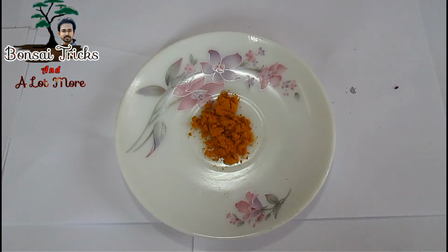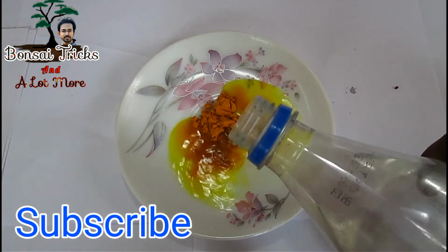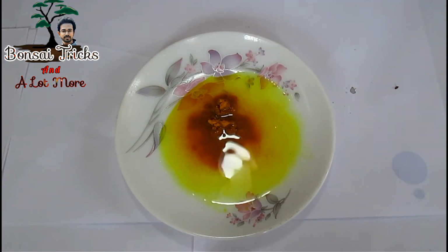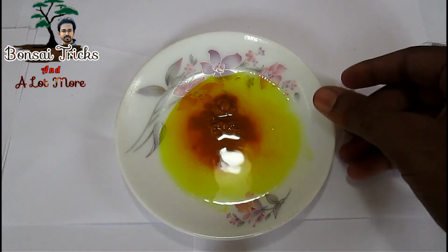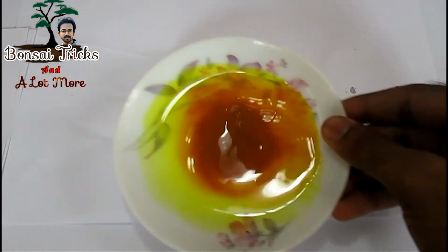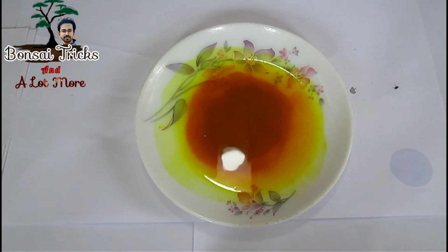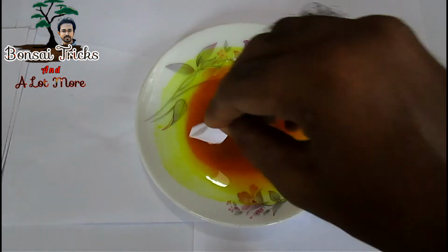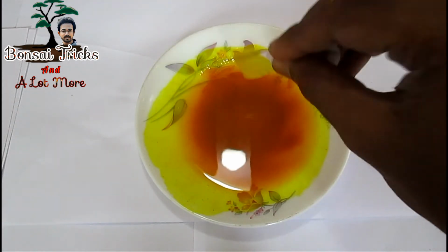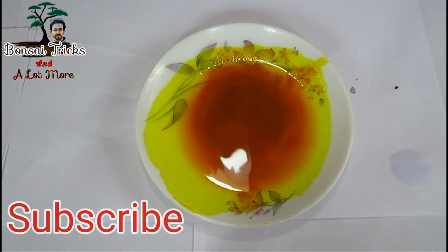Now we are going to learn how to make pH strip from turmeric powder. I am using turmeric powder and ethyl alcohol. As turmeric powder doesn't dissolve into water, I have to use ethyl alcohol to dissolve the turmeric powder. If you are not experienced enough to handle the chemical, then please wear gloves. The turmeric pH indicator solution is much more efficient than our rose juice. It turns into bright red or yellow in basic or acidic solution, so you can easily notice the change in color.